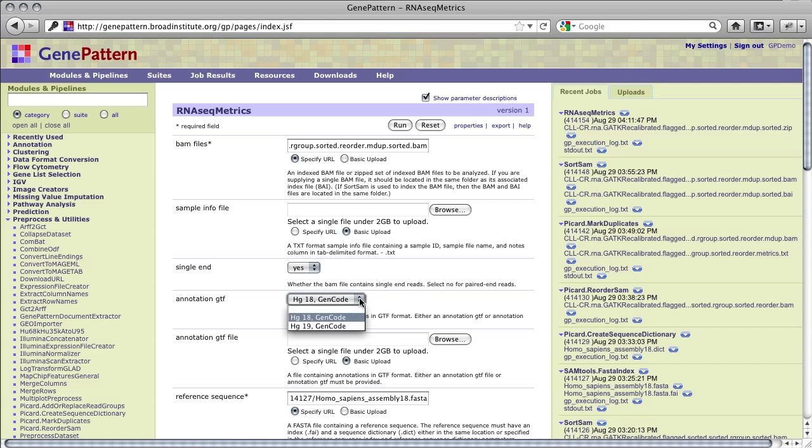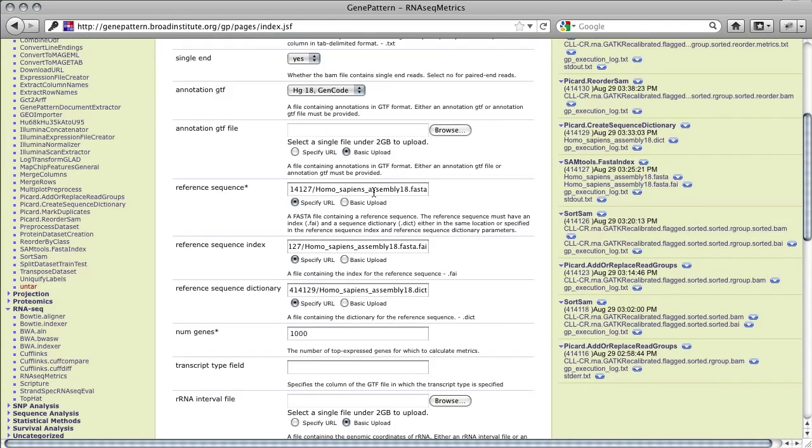A GTF annotation file is also required. An HG18 and HG19 GTF annotation from GENCODE are provided in a drop-down list. Other genome annotations must be provided by the user. For our data in this tutorial, we'll choose HG18. Also required is a reference FASTA .fa file as output by SAMtools faidx, the reference FASTA file index .fai also output by SAMtools faidx, and the reference FASTA file dictionary .dict as output by Picard CreateSequenceDictionary. Note that in most cases, these last three files will all need to be specified separately, as we did here, because they will likely not be in the same directory.